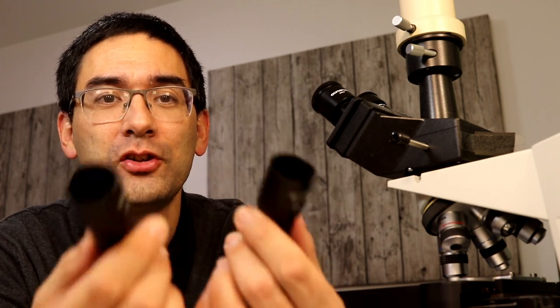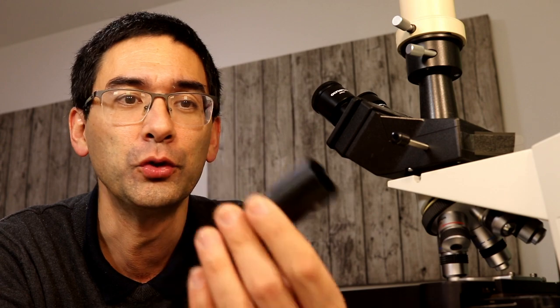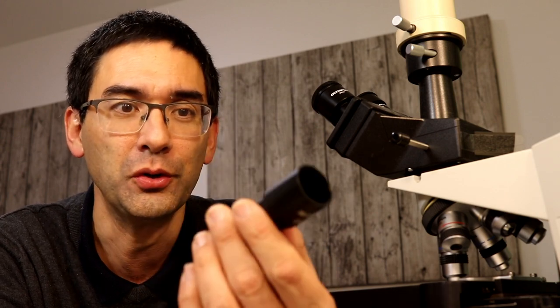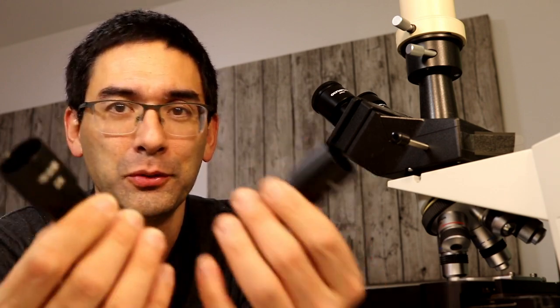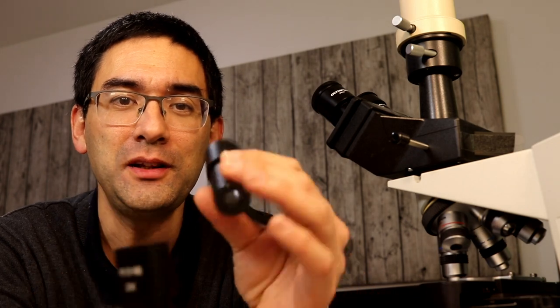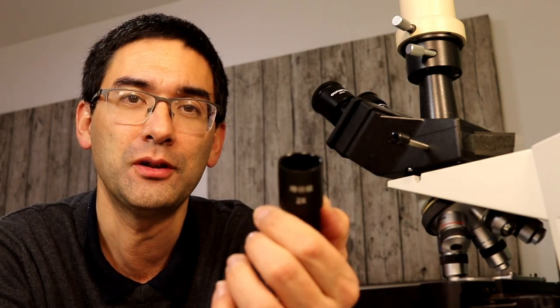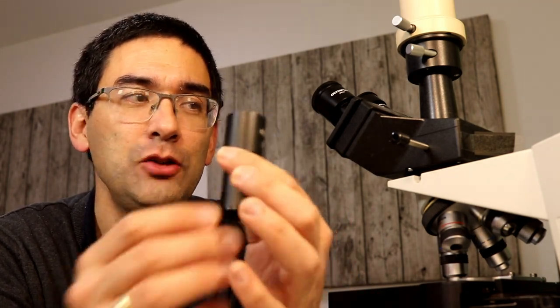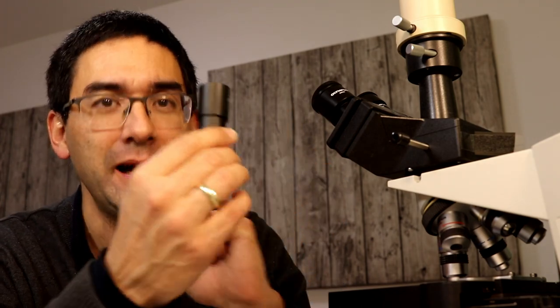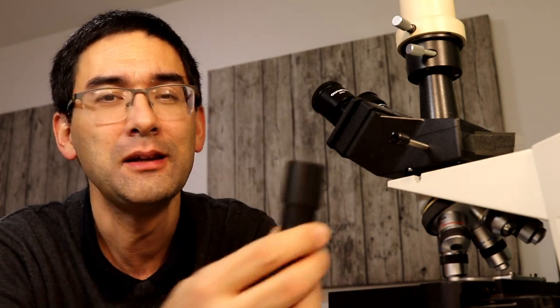I'm going to increase the magnification tenfold and it's relatively easy to do that because all you need is Barlow lenses. These Barlow lenses were quite cheap. By changing the magnification of the eyepiece and inserting these Barlow lenses I can basically get any magnification I want.